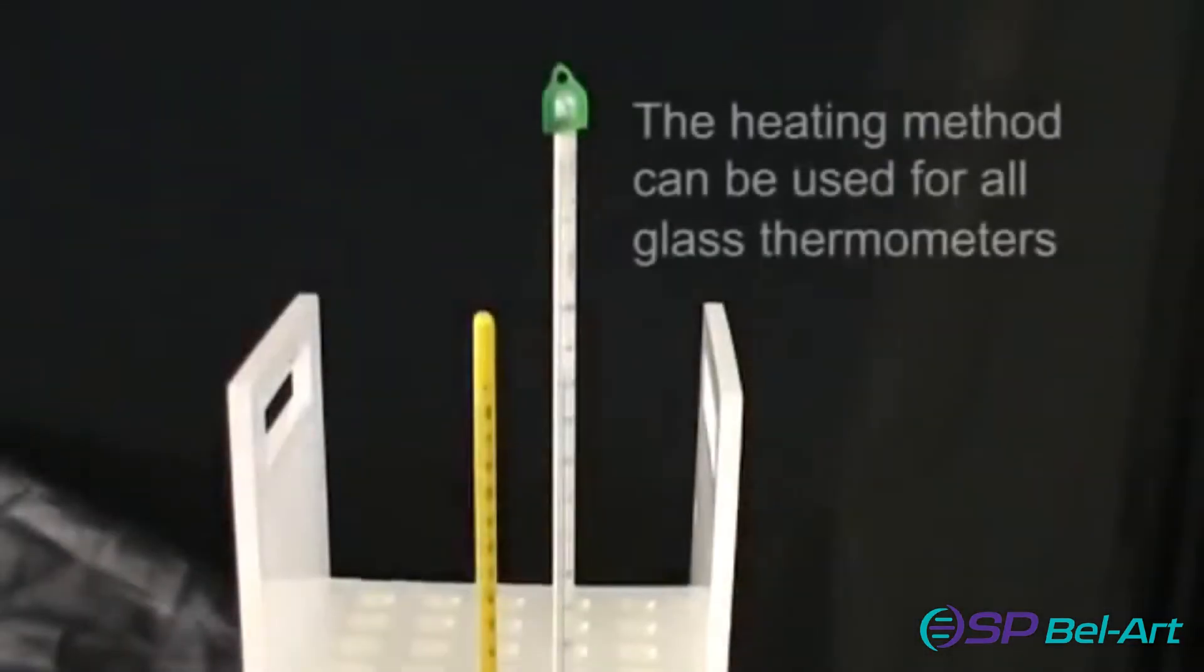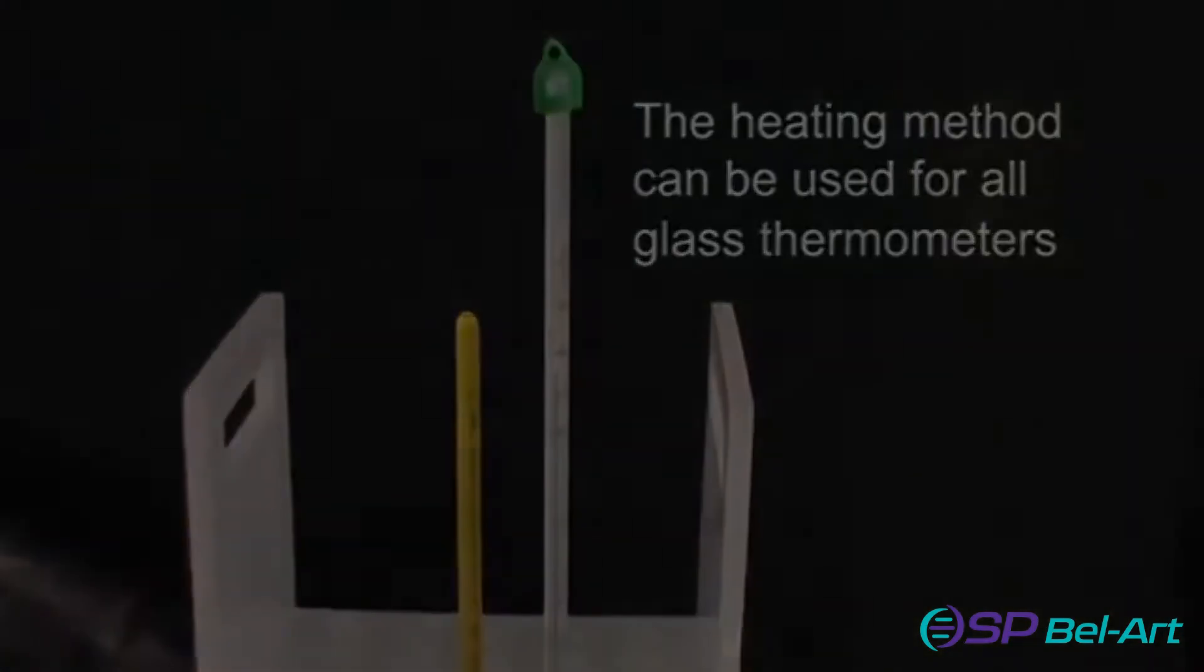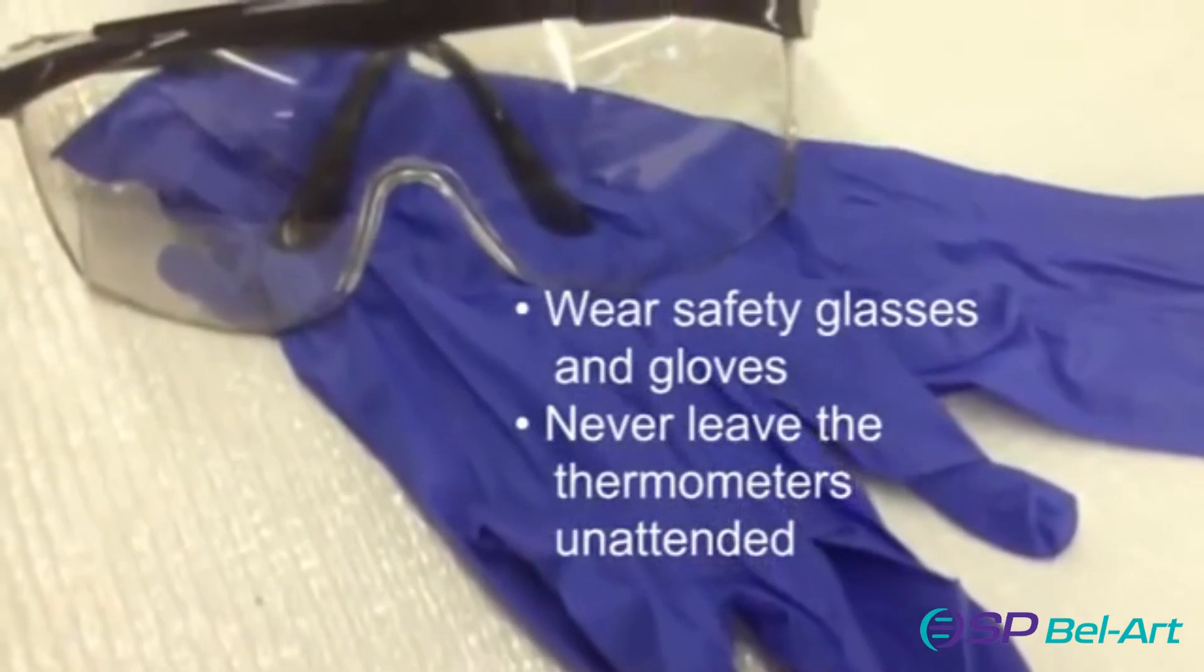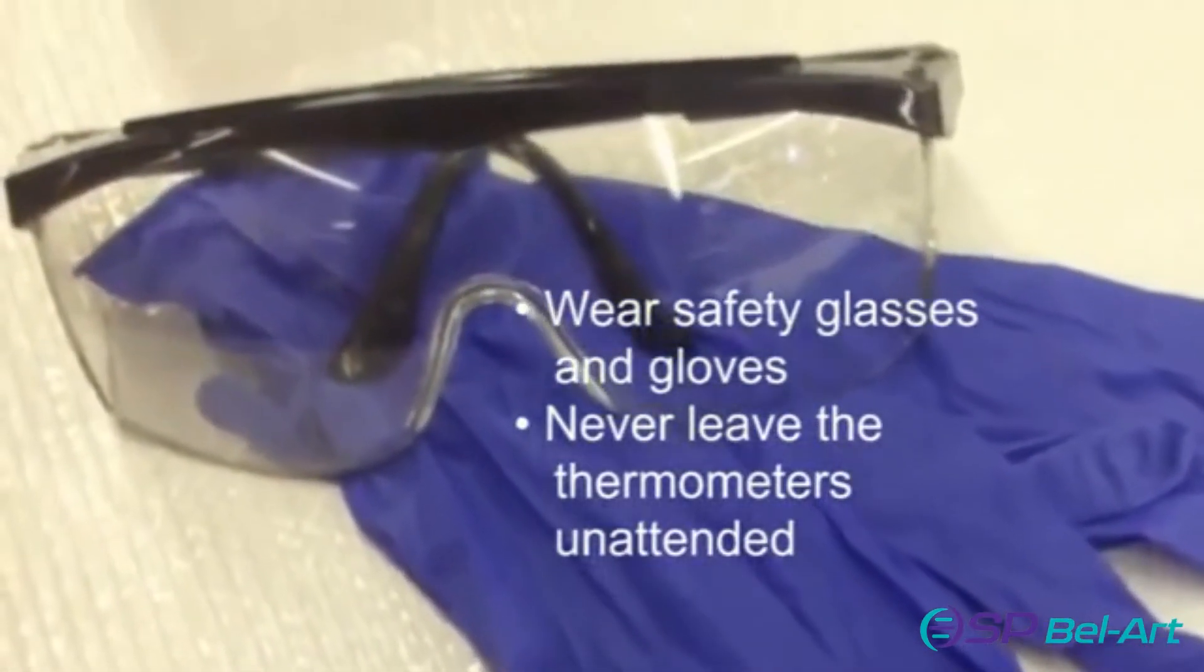The heating method may be used with organic or mercury filled thermometers. Again, we strongly suggest you wear safety glasses and gloves and never leave the thermometer unattended while working with them.